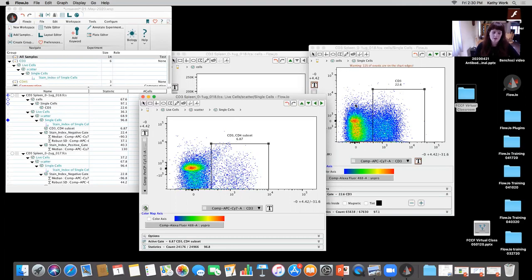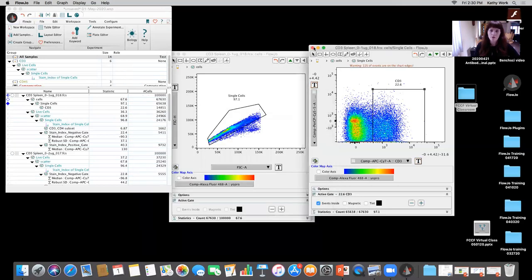We highly suggest under all circumstances to include a viability dye, because when you don't, you can very clearly see here what's going to happen to your statistics, okay? You're going to have a dramatic difference in what you see for frequency and also for total count. So it's a very basic one, but please include a viability dye at all times. And I really just wanted to make sure that we mentioned how important that really, really is.